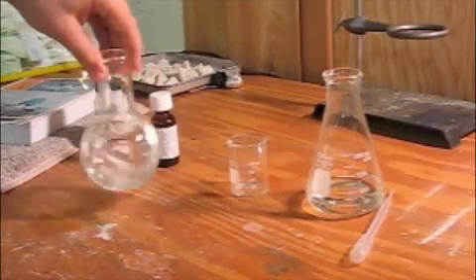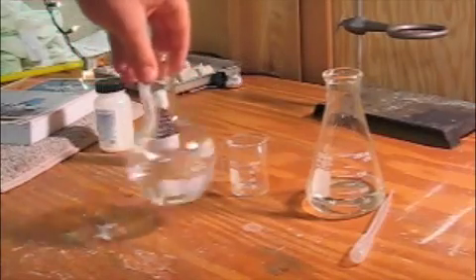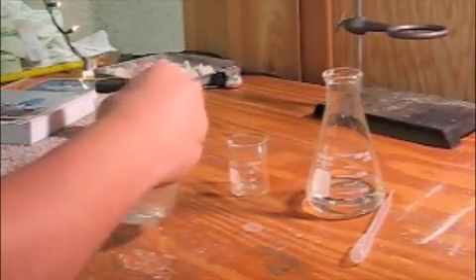Just a little swirling, and we pretty much have it.